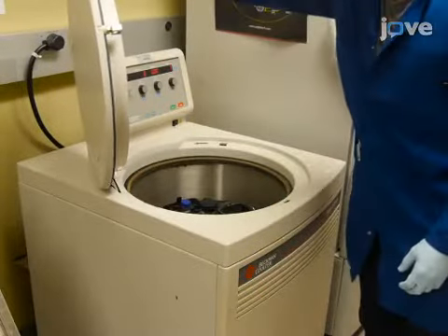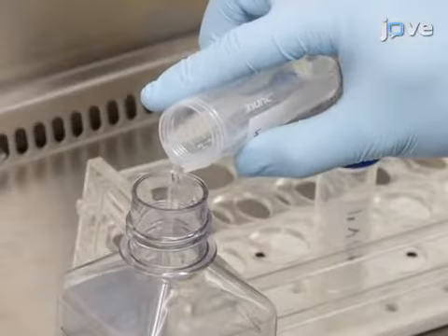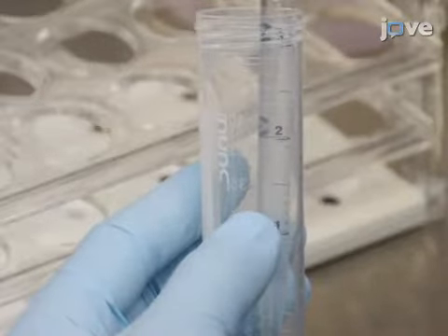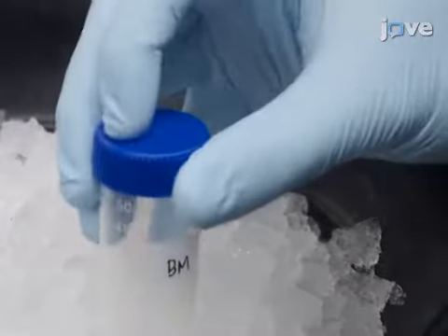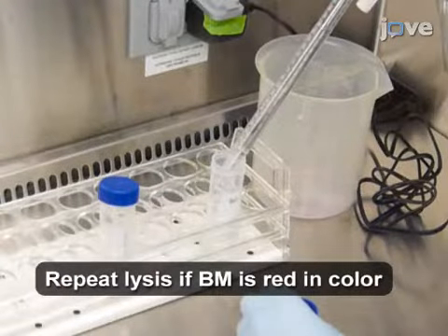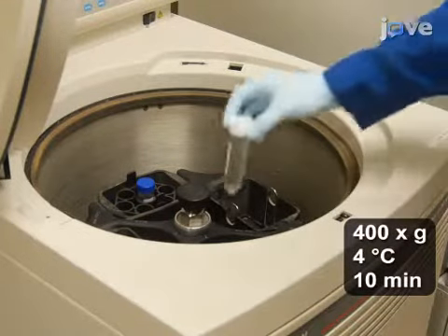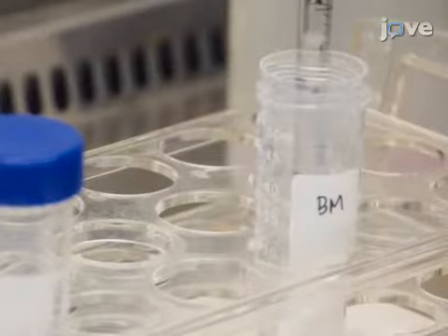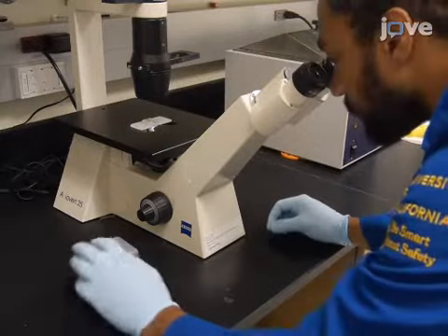Centrifuge the harvested cells at 400 times G and 4 degrees Celsius for 10 minutes and discard the supernatant. Then, add 5 milliliters of ammonium chloride potassium, or ACK, to resuspend the bone marrow. Incubate the cell suspension on ice for 10 minutes to lyse the red blood cells. To stop the lysis, use PBS to fill the tube. Then centrifuge the cells again and discard the supernatant. With 5 milliliters of PBS, resuspend the cells and, by trypan blue exclusion, use a hemocytometer to count the cells.